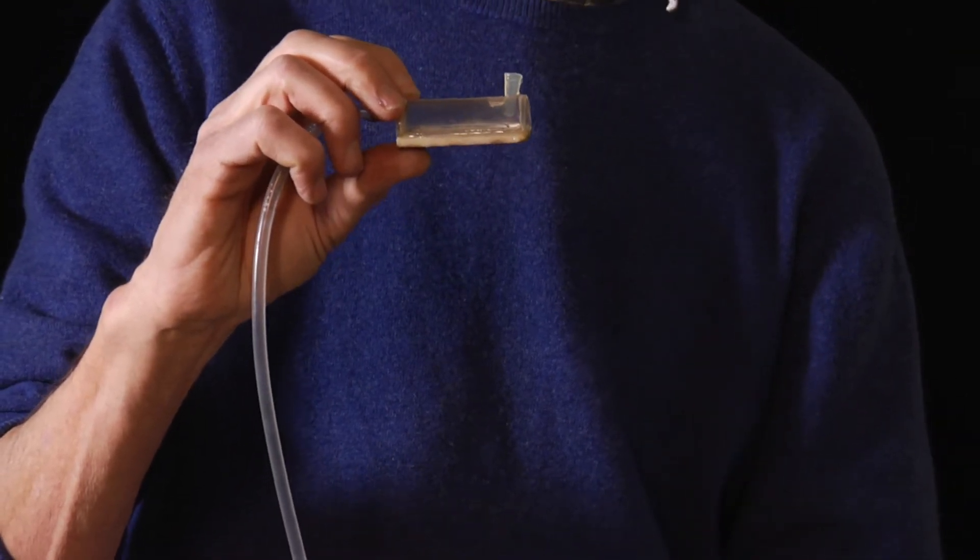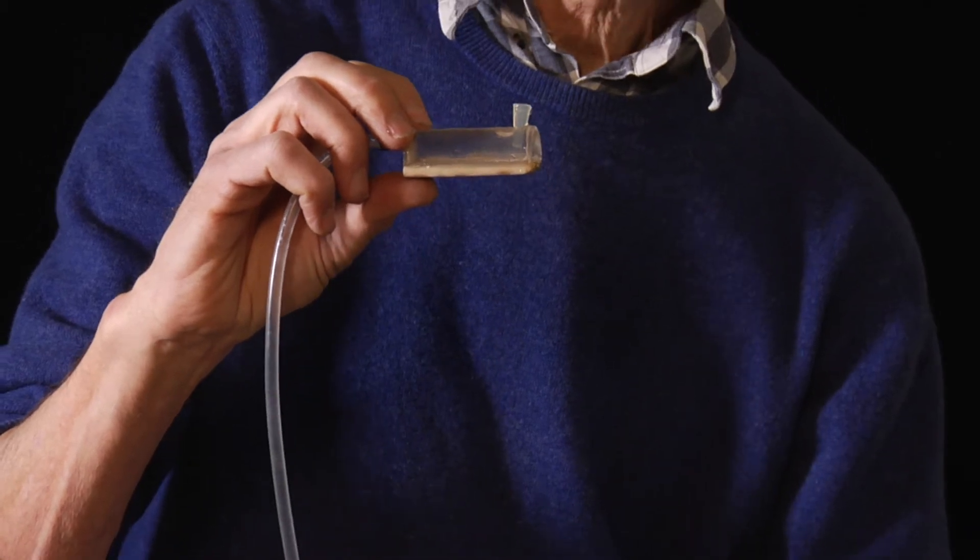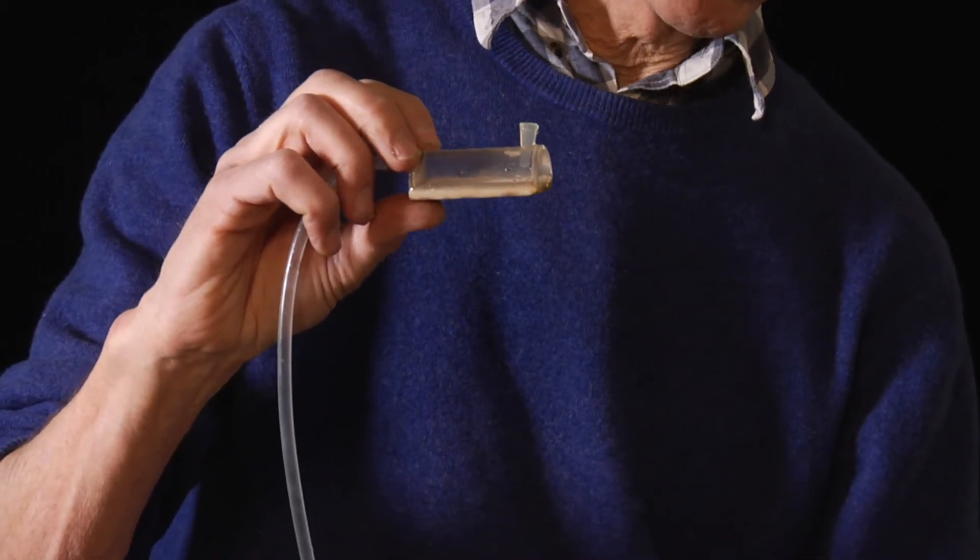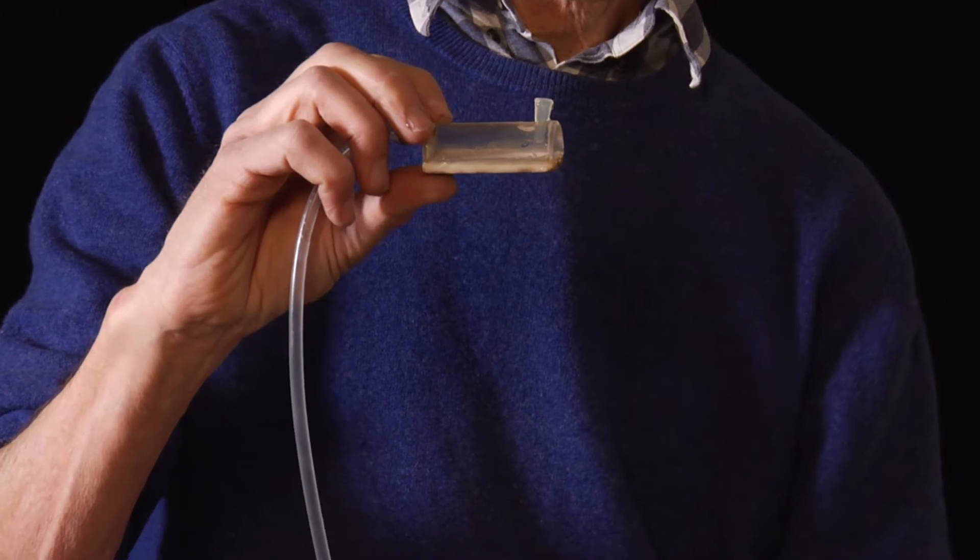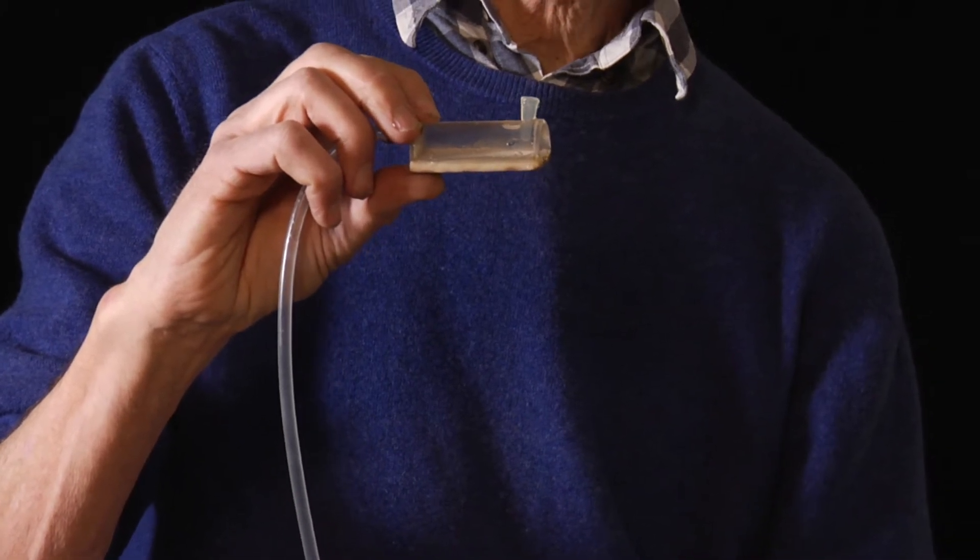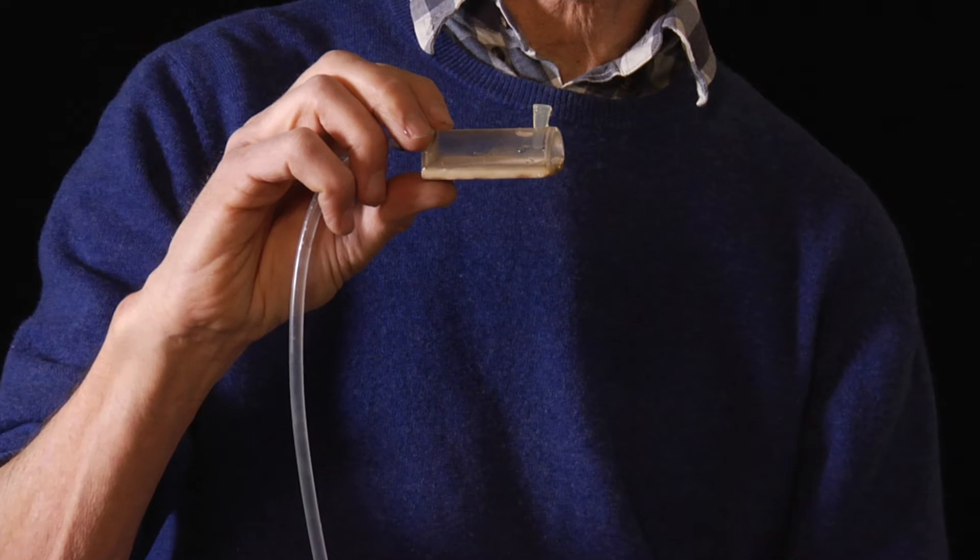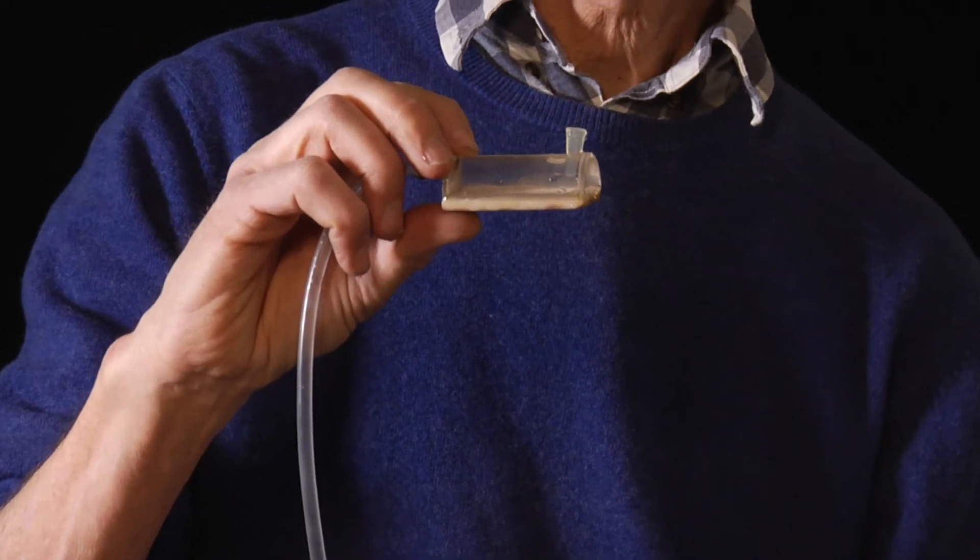I continue to gradually lower the open end. Now I have created a suction or negative pressure of around 50 centimeters, and the pores in the plate have the ability to hold the water against this suction.